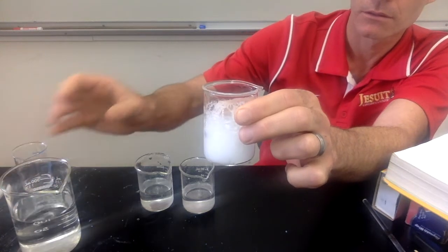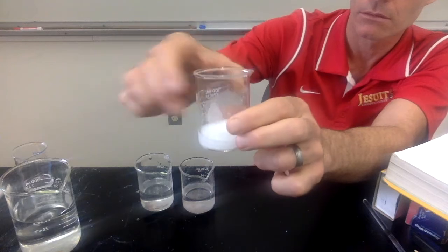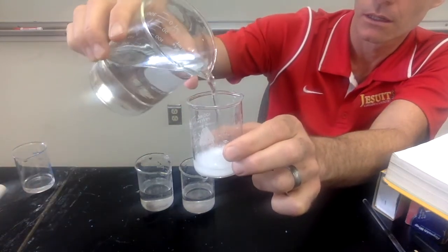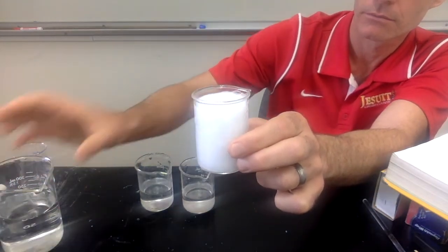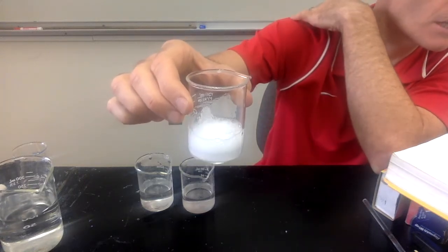A little bit more. You can make your observations there for investigation number 9.